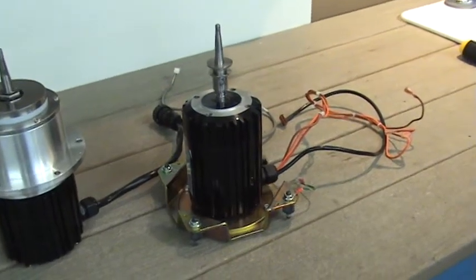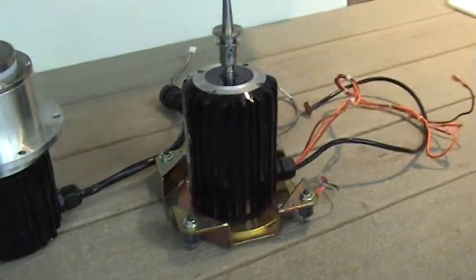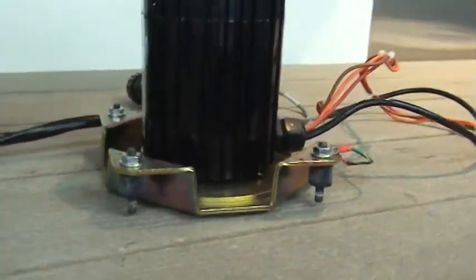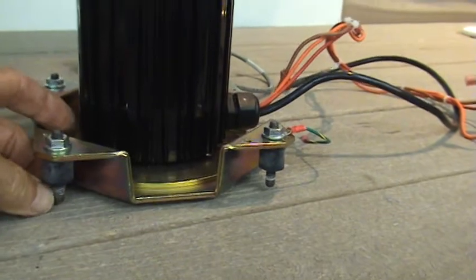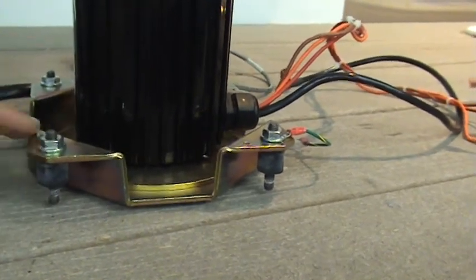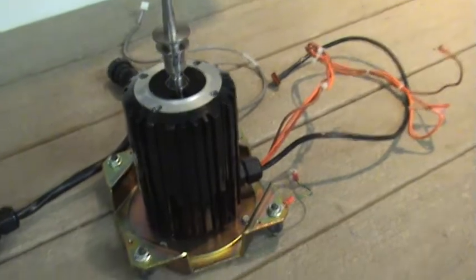This is a view of the drive mechanism from the thermocentrifuge you just saw. It consists of a motor here, and then this mounting system, which basically uses rubber donuts. These mount hard to the chassis and are suspended, and the rest of the motor is suspended through this rubber piece and allows the entire motor and rotor to shift.